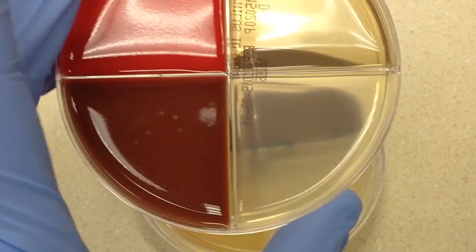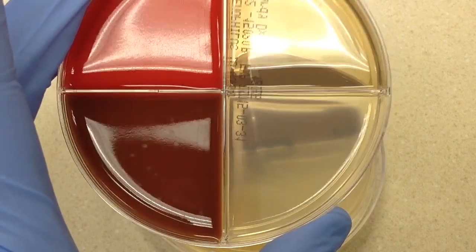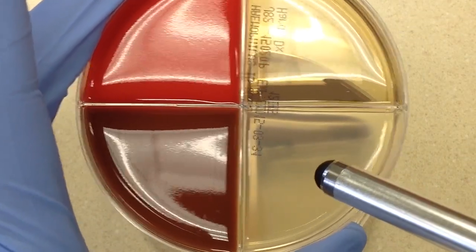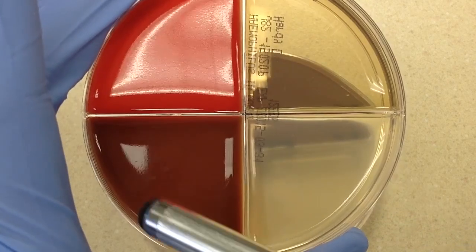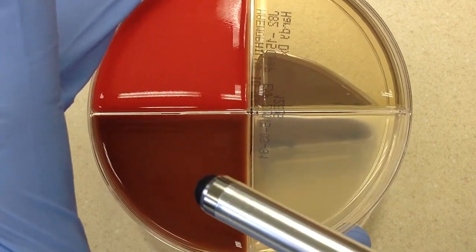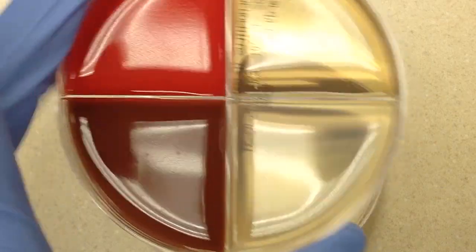The third quadrant contains V factor only. And then the fourth quadrant is just chocolate agar, which of course contains both X and V factors.